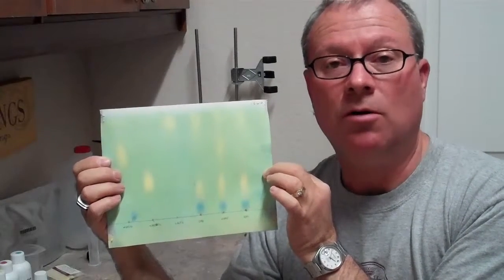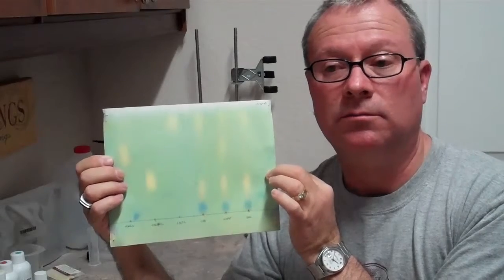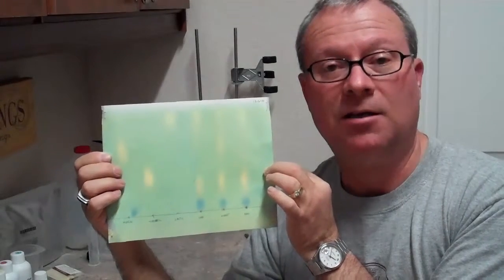That's what it looks like once it's dried. Pretty easy process. Anybody can do it; just gotta buy the kit, and that way you know when your MLF is done.